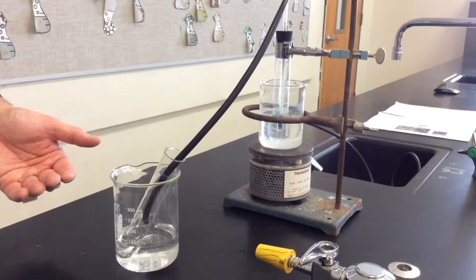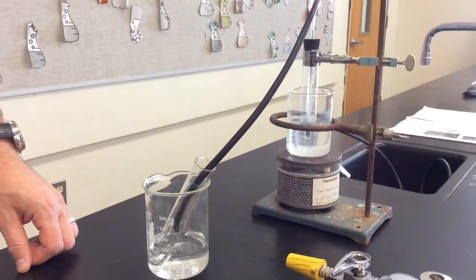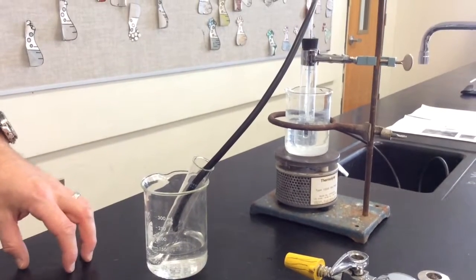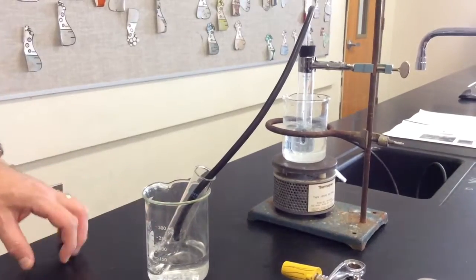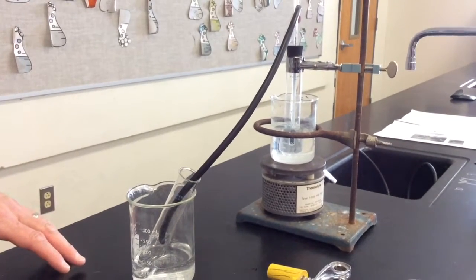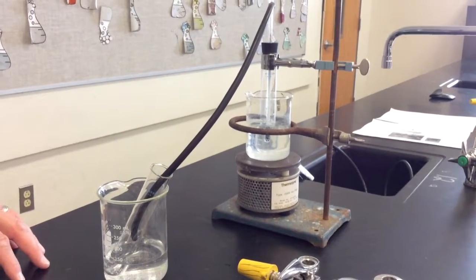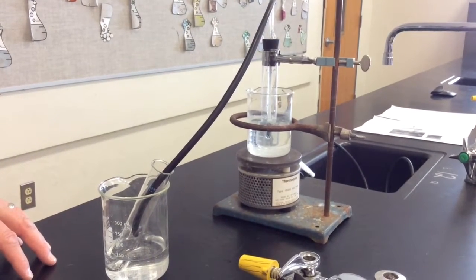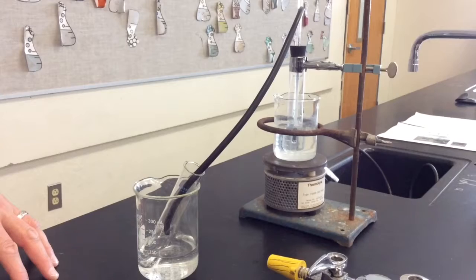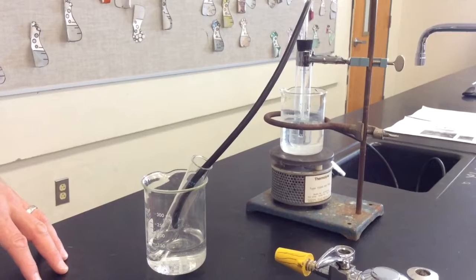The purpose of this lab, again, is to determine what type of alcohol is in your sample. And you're going to take a look at the point at which that alcohol boils to determine which type of alcohol you have. You'll be given 3 different choices: isopropyl, ethanol, and methanol for types of alcohol, and you'll be given their boiling points. You're going to be able to recognize what temperature these things boil because you're going to have a plateau on your graph. There'll be a time for about 3 to 4 minutes that you're going to get a constant temperature using your thermometer in that alcohol water mixture.